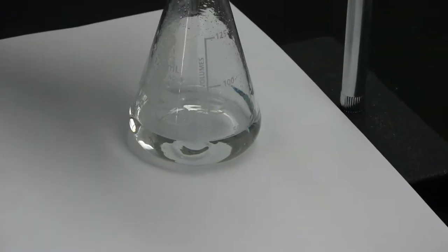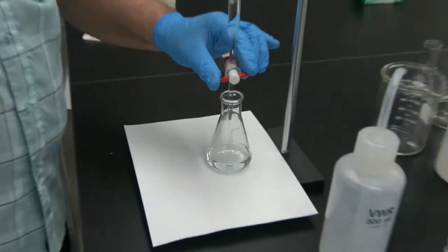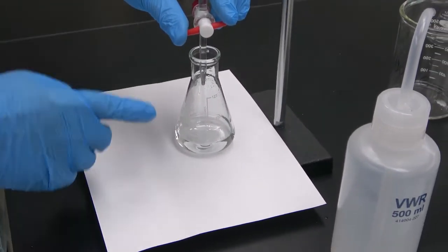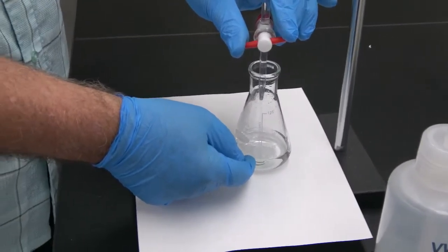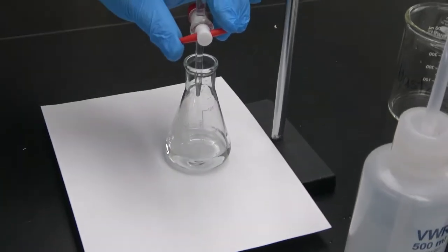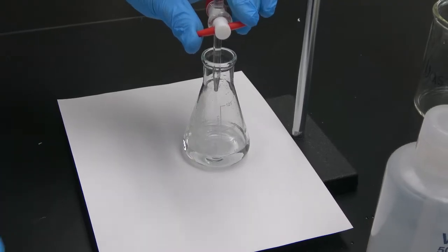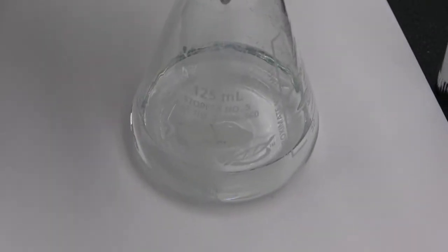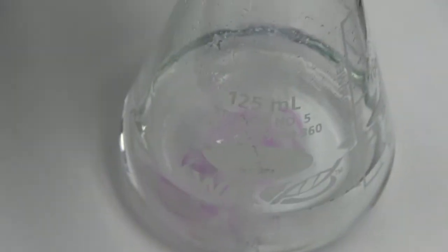So we're going to continue like that until we get close to what we believe is going to be the point where the moles of sodium hydroxide that we're pouring from the burette is going to be equal to the moles of acetic acid that I had at the beginning in the Erlenmeyer. And that's going to be when this solution turns from colorless to pink. As we get closer to the final point, you see that the pink color becomes more and more persistent. Okay? See?